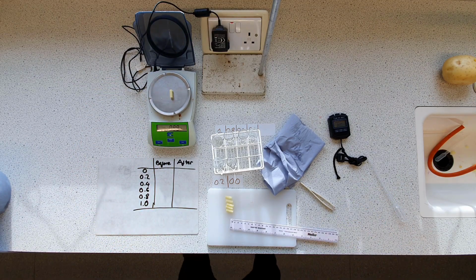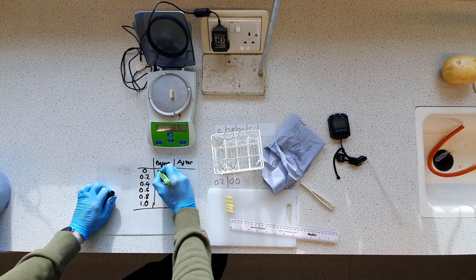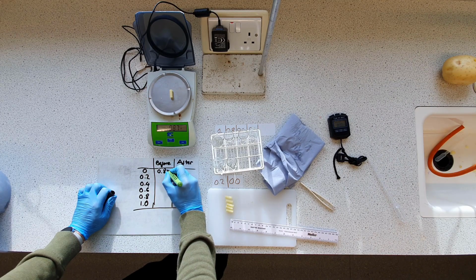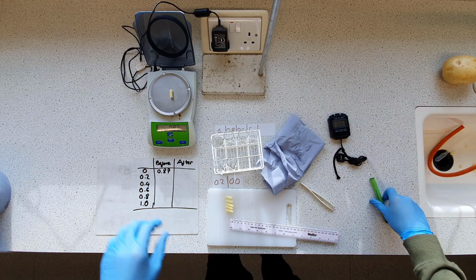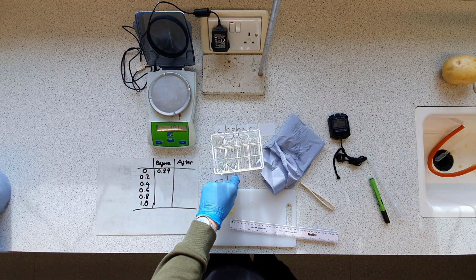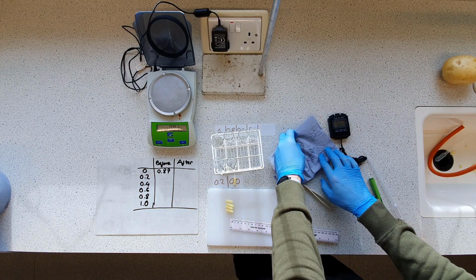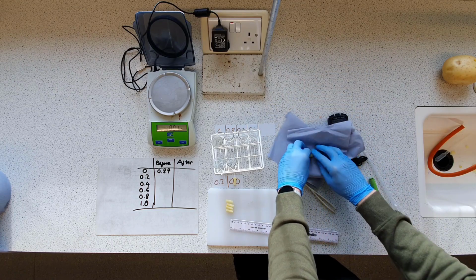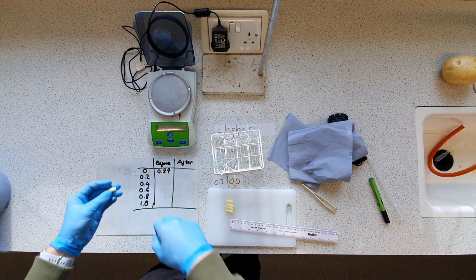And our results. So once it settles, 0.87. So this is going to go in zero concentration. Going with 7 even though it's fluctuating. So that's going to go here. We're going to do the same blotting procedure. I have to move the paper about just to get some dry bits. Just blot it dry, make sure it's zeroed.